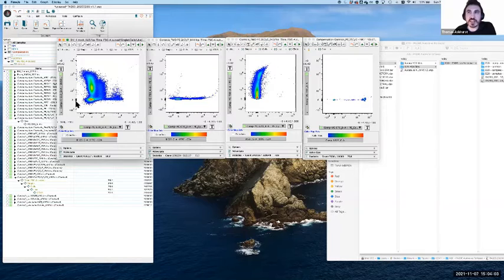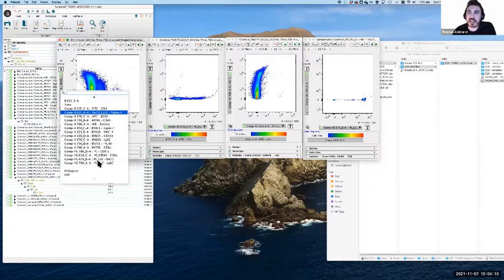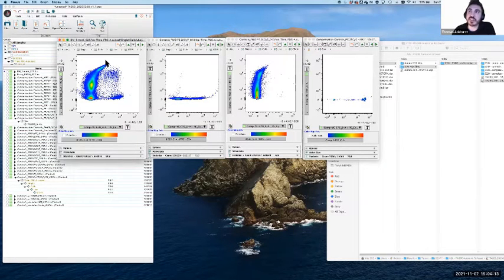And so we don't really get a red flag here that something has gone wrong in the same way that we might if we had that super negative. So I really need to have checked the actual combination of the offending fluorophore, the target, and the non-target detector to see this undercompensation problem. These are much harder to spot because you really have to go and check each of these combinations. But essentially the same rules apply. We've identified and flagged it, and now we want to see if this is genuine or something which is not real, which we need to correct.